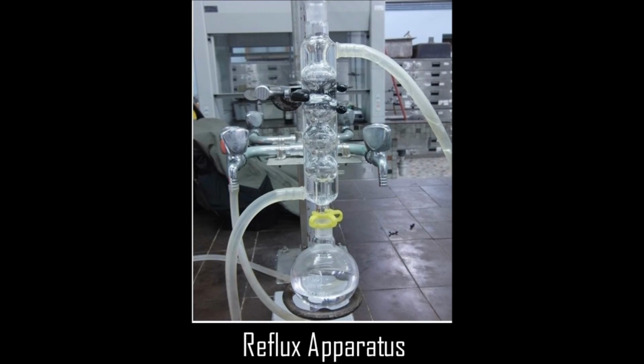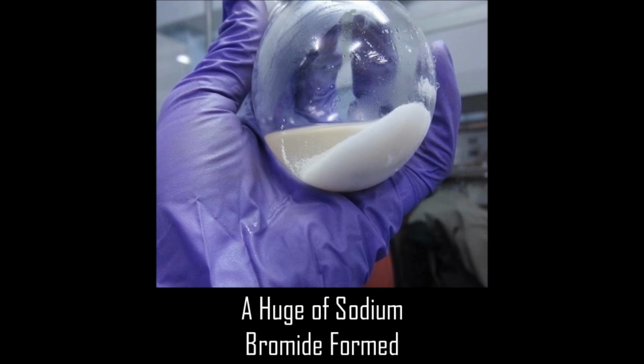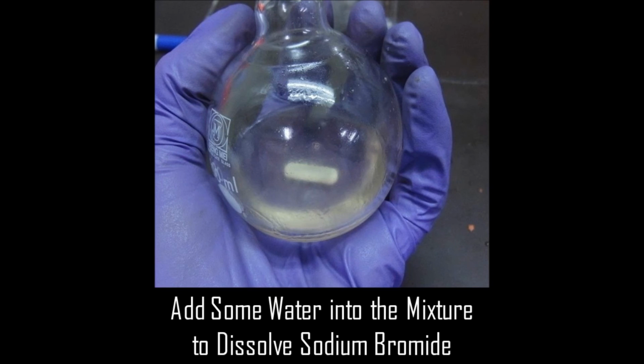After the addition has been completed, let the reaction vessel stand at room temperature until the exothermic reaction has subsided and the methanol ceases to reflux. Then, heat the mixture at a gentle reflux or simmer for 1/2 hour with a heating plate. The mixture will bump because of the precipitated solid. Therefore, do not attempt a vigorous reflux. After the reflux, cool the reaction vessel with a water or ice bath and add 4 to 6 ml of water to the mixture through the reflux condenser. If all the sodium bromide does not dissolve, add a few additional milliliters of water. Dissolving the sodium bromide prevents bumping in the next step.